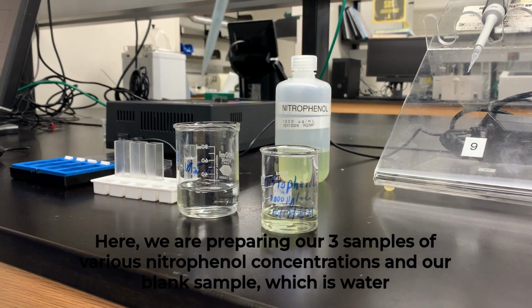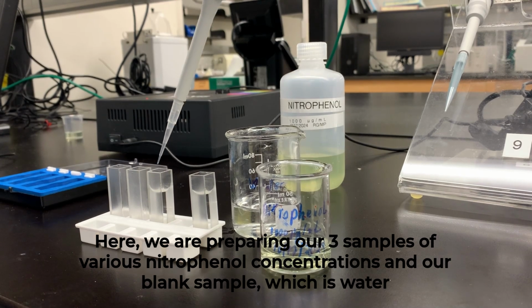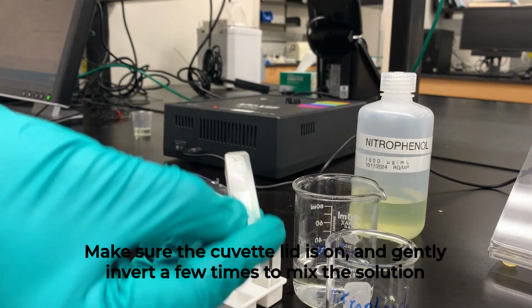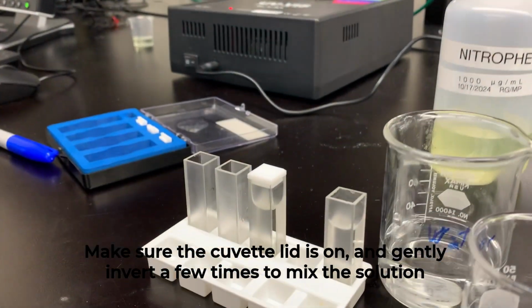Here, we are preparing 3 samples of various nitrophenol concentrations and our blank sample, which is water. Make sure the cuvette lid is on and gently invert a few times to mix the solution.